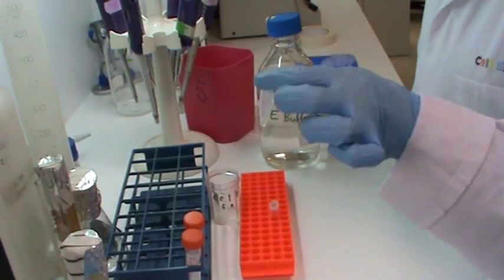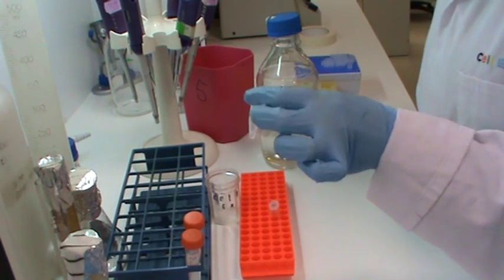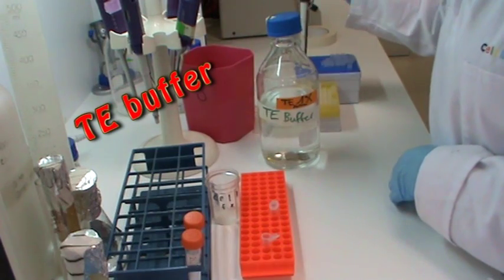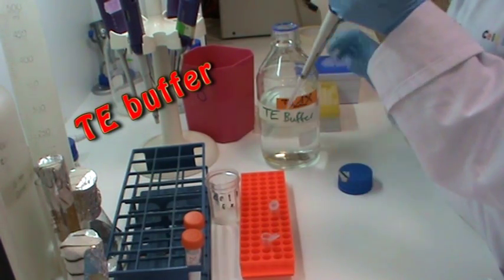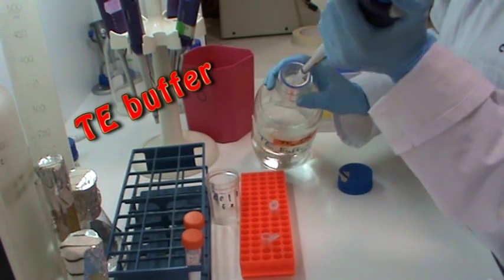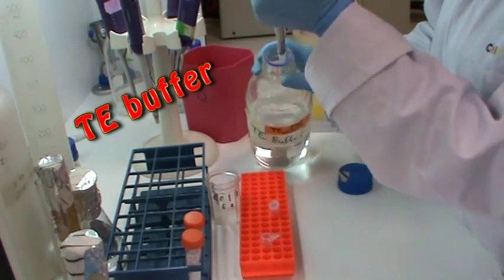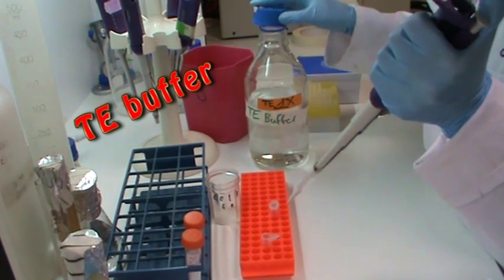Now that the DNA is dry, I am going to resuspend it in TE buffer. This protects the DNA from being degraded.